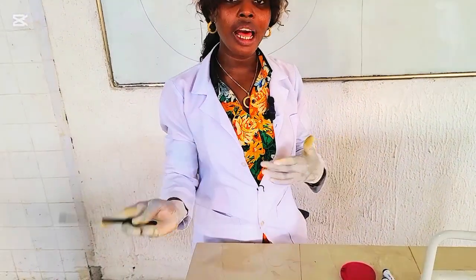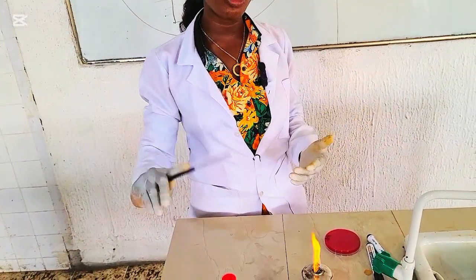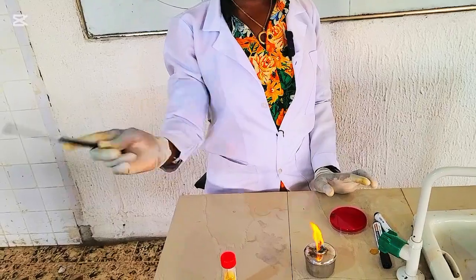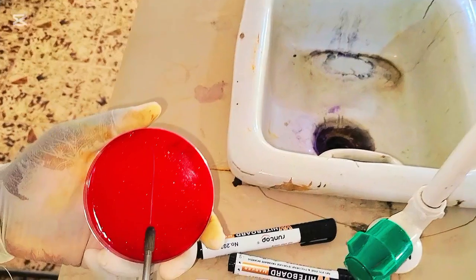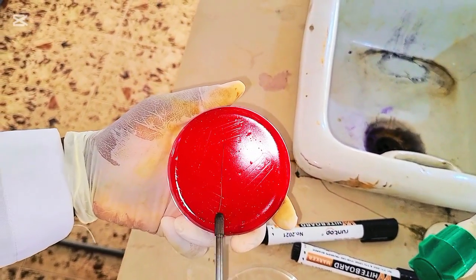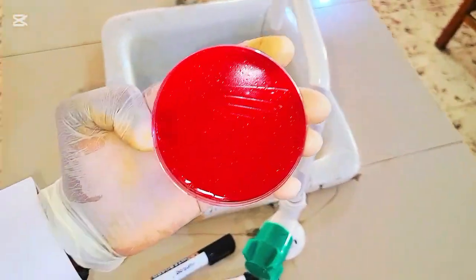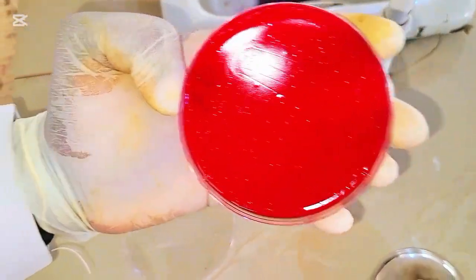Be patient enough to allow the wire loop to cool. Allow the wire loop to cool so you don't kill the microorganisms. That's why we wave our hands like this, to allow air to cool it quite faster. Now we streak for streak E. We'll take it straight from the distal end of D, and then we streak zigzag. So this is streak E. So at the end of the day, this is how it looks. So this is how your standard streak should look.